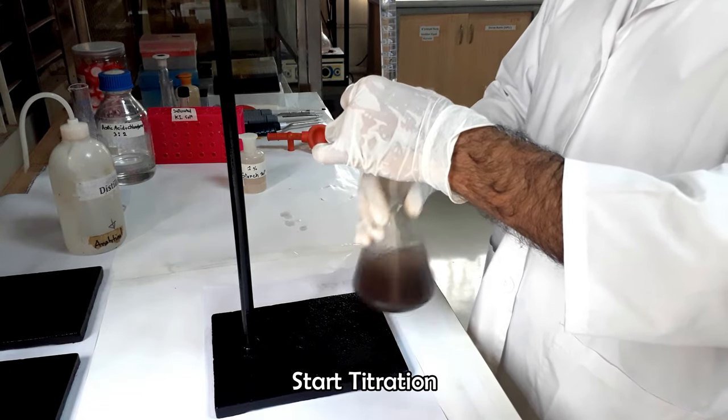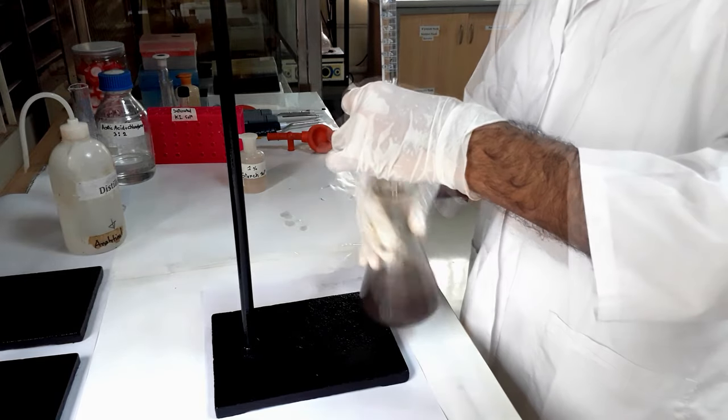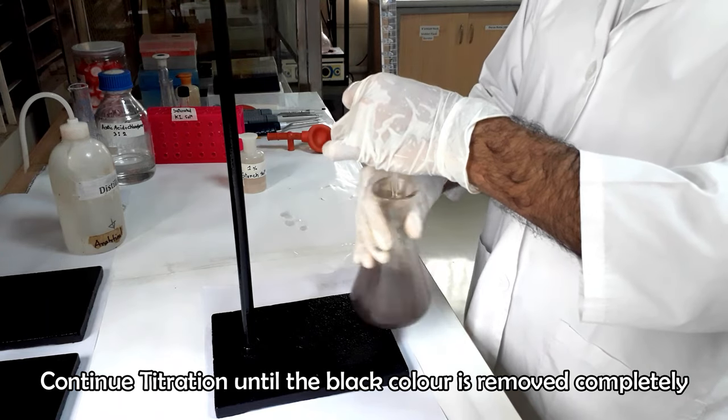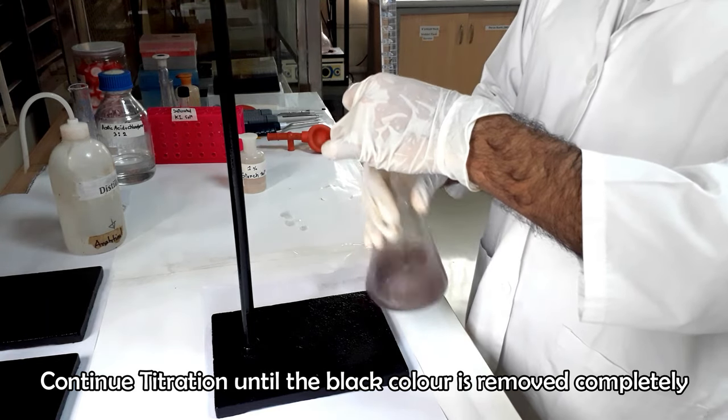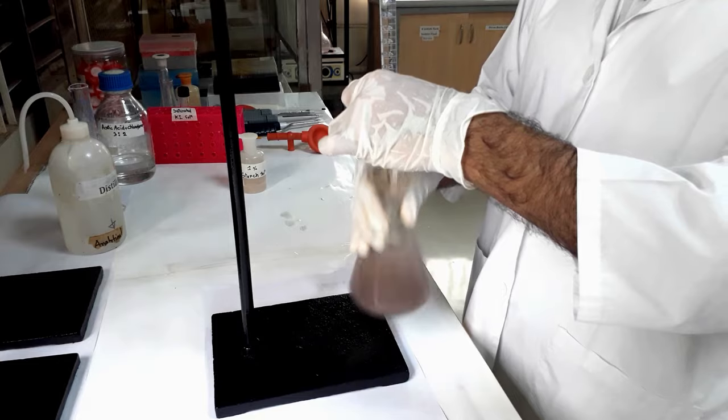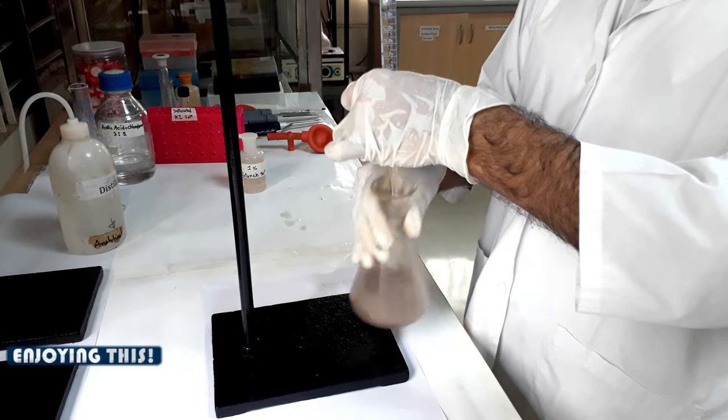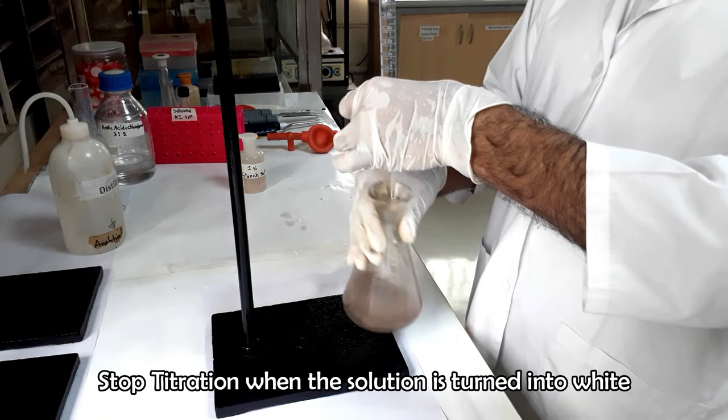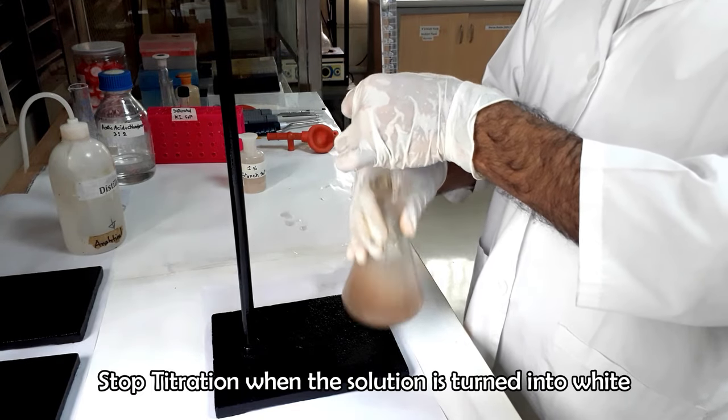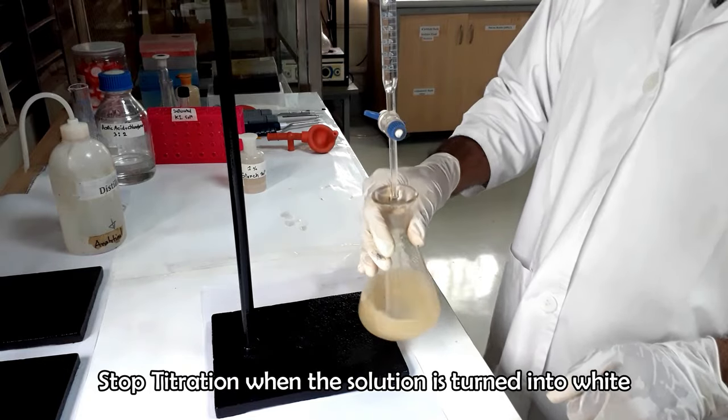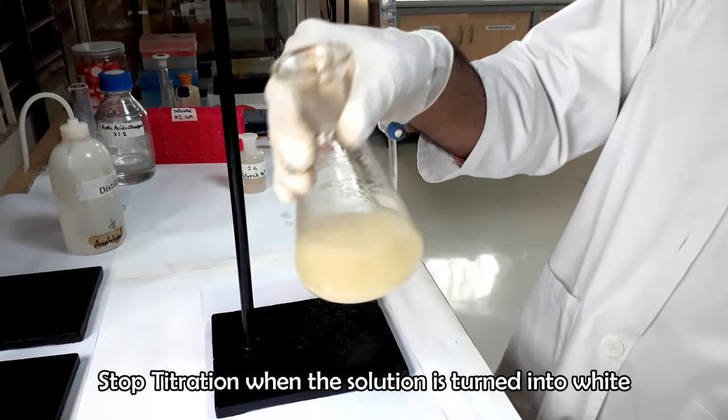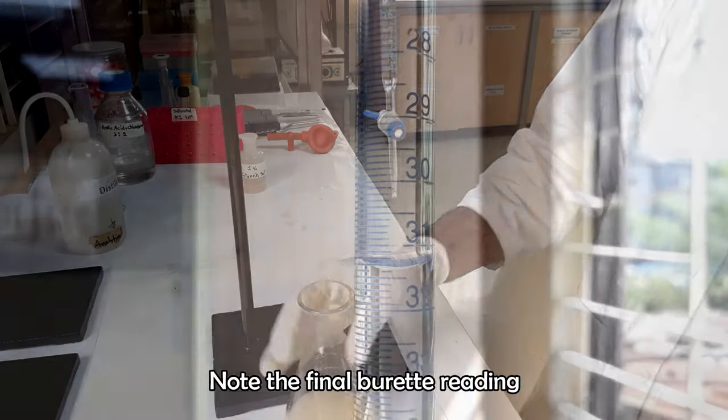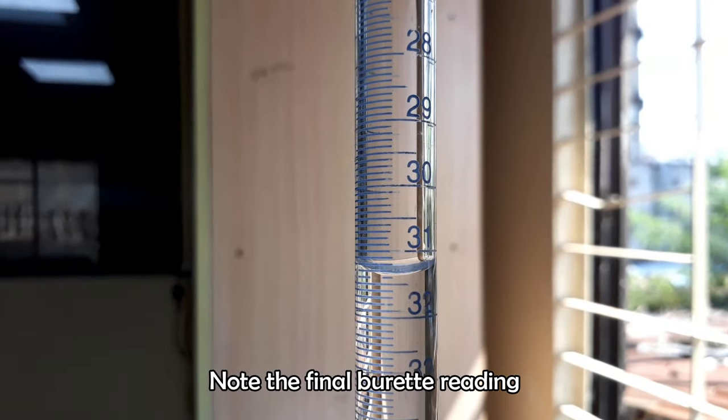Titration should be carried out with vigorous agitation of the flask to get the accurate results. Stop the titration when the solution color is changed into white. Note the final burette reading.